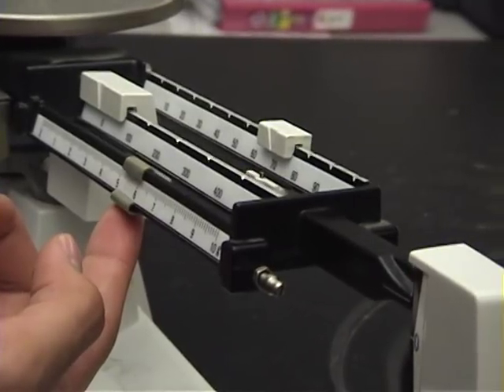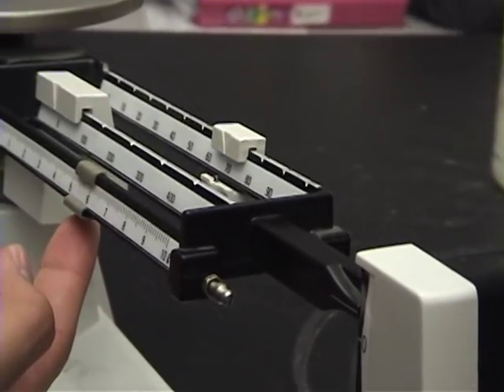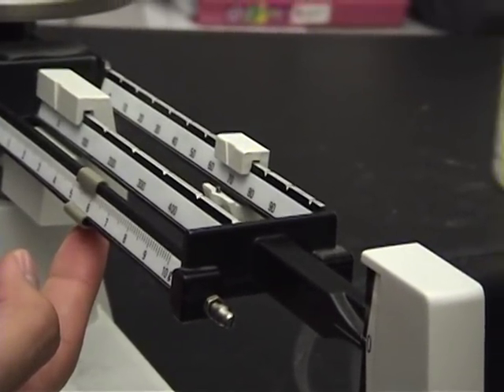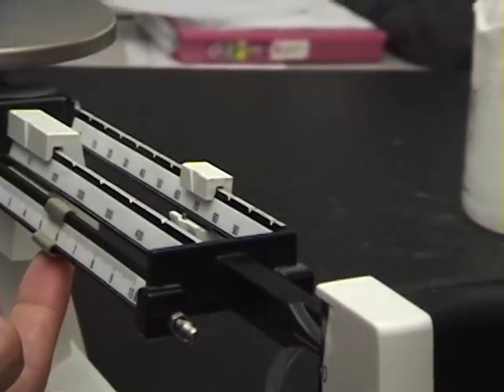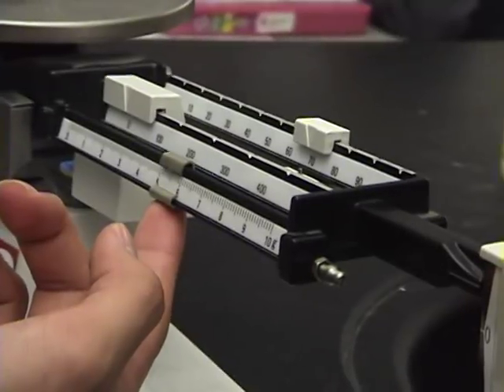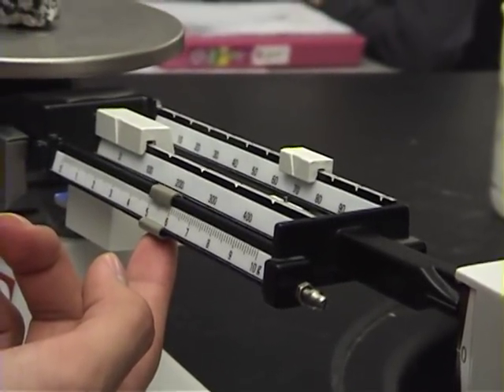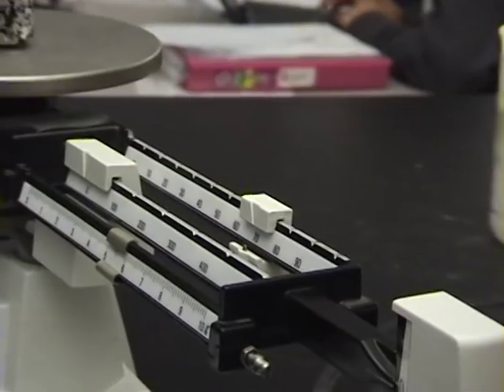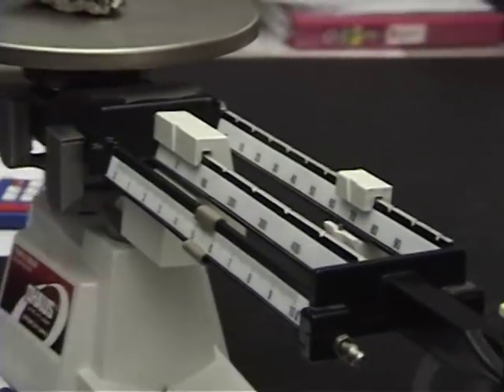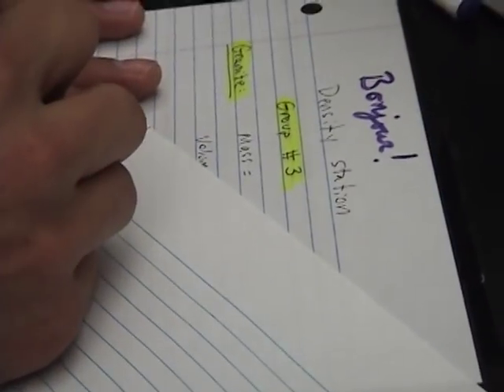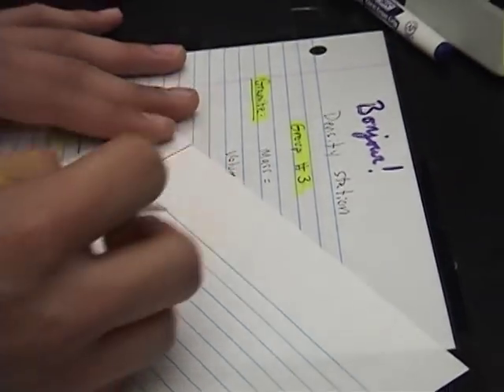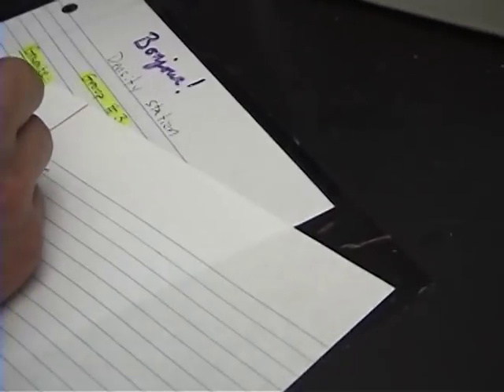Seventy-five point five. So this is seventy-five point five grams. So we have to go ahead and write that down. Oh, this is granite.